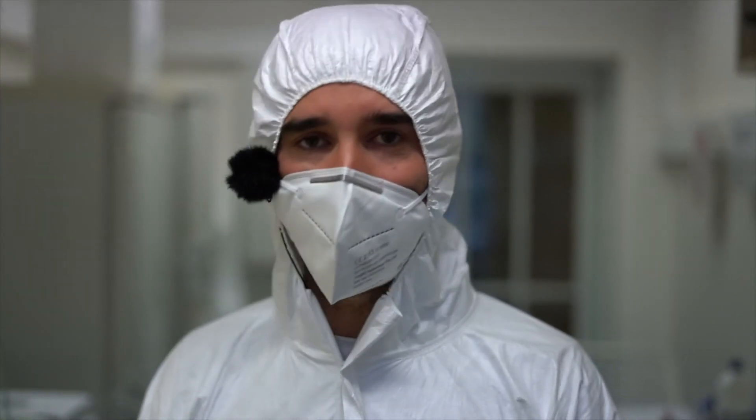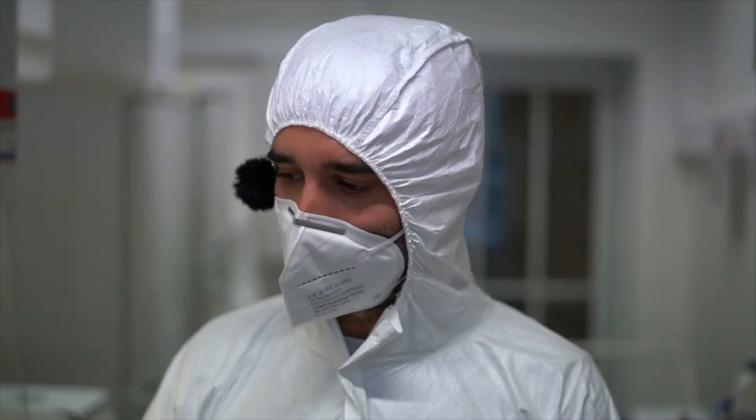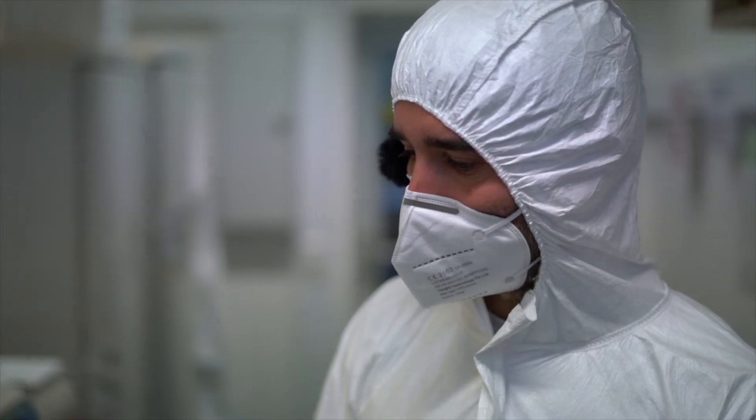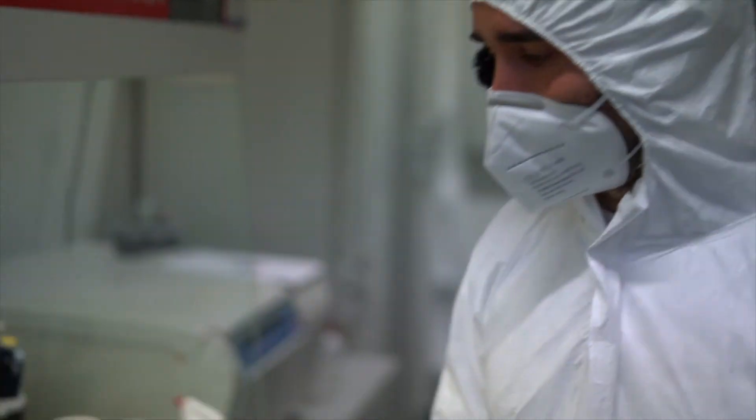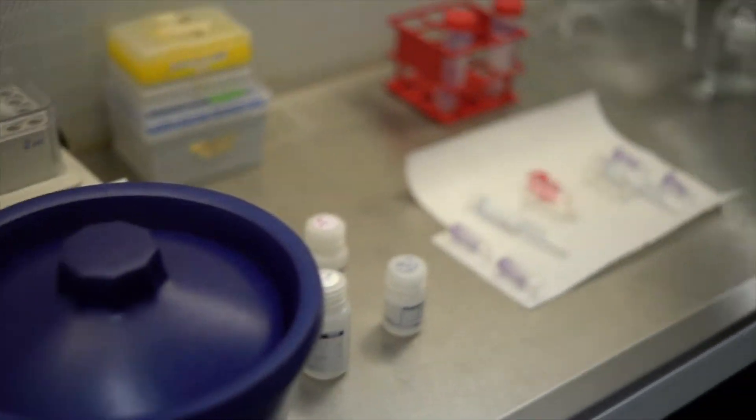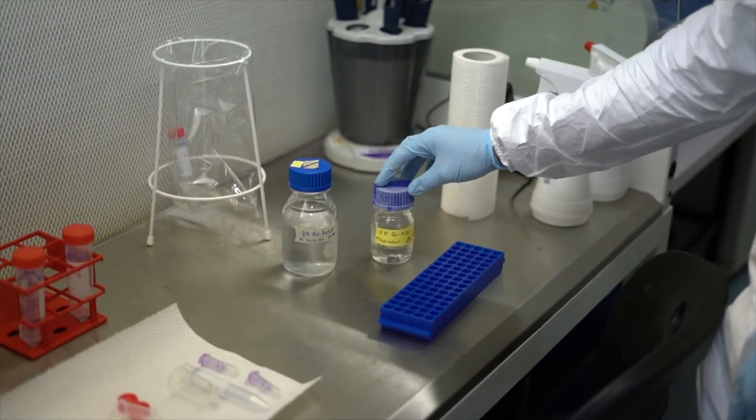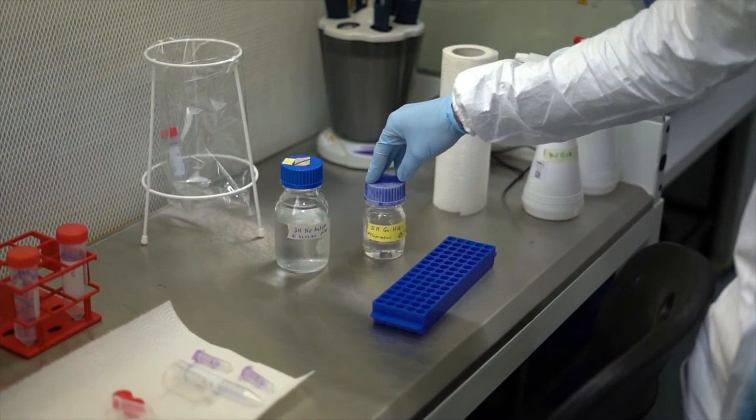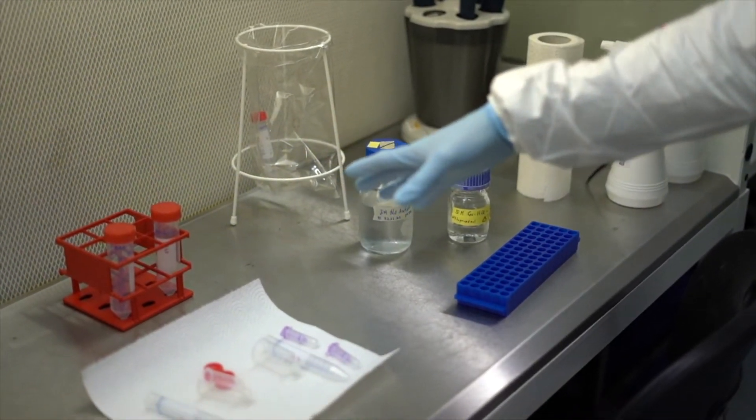We will continue today with the extraction. The samples were incubating overnight, they are still incubating in the thermoblock at 37 degrees. I will show you briefly what we need for today. We need some ice for later, we need the buffer or the solutions that I showed you yesterday: the binding buffer, the guanidine hydrochloride buffer and sodium acetate. We need some plastic consumables.